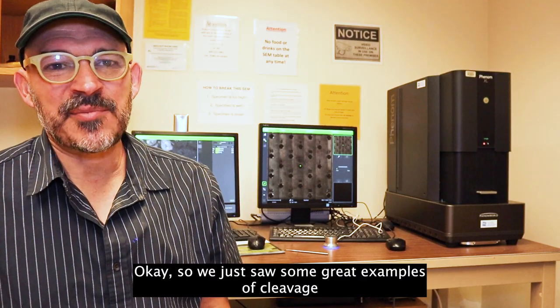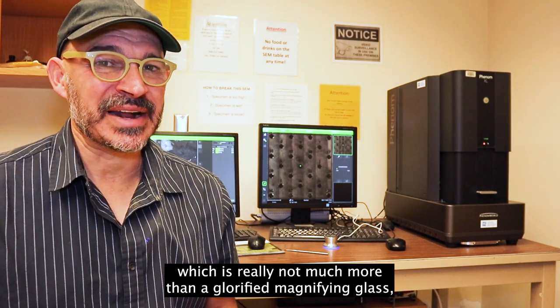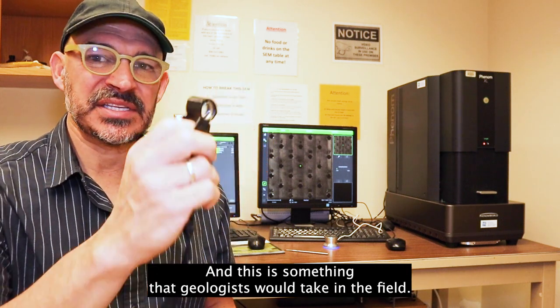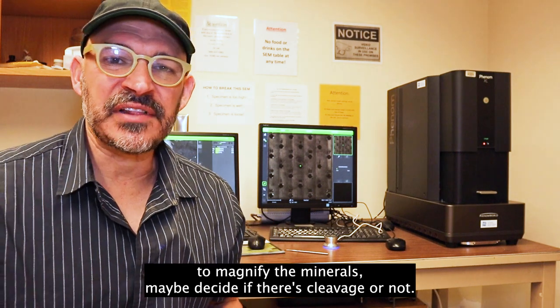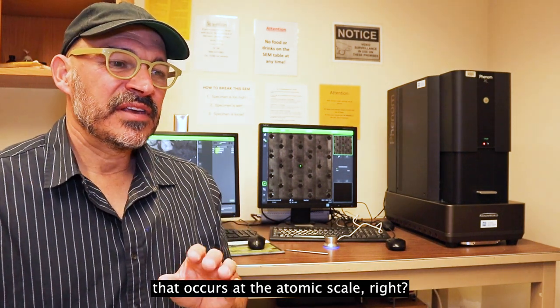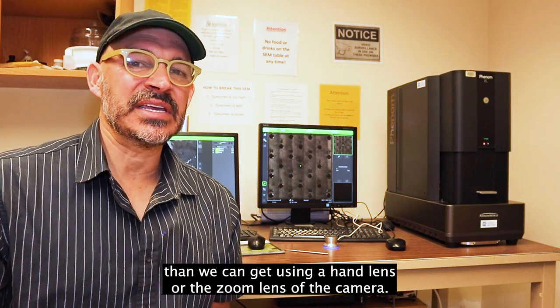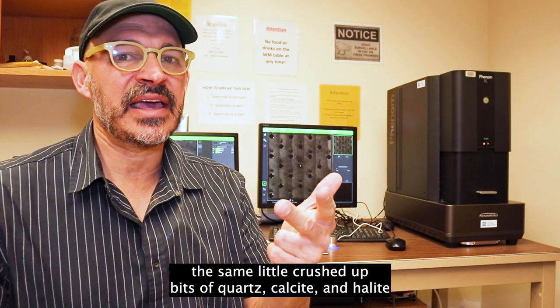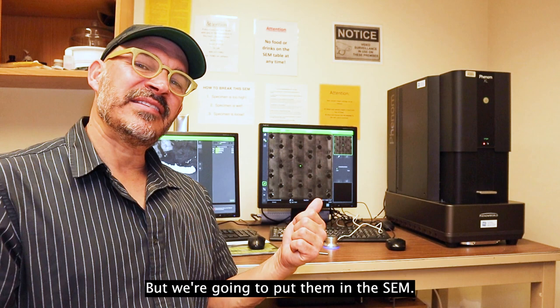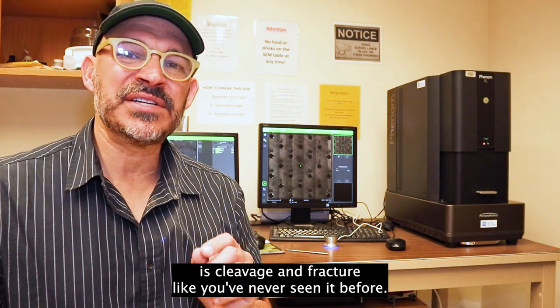We just saw great examples of cleavage in minerals at high magnification using the zoom lens of a camera, which is really not much more than a glorified magnifying glass — kind of like a hand lens that geologists take into the field to examine rock specimens and decide if there's cleavage or not. But cleavage occurs at the atomic scale — between atoms — so it occurs at much higher magnifications than a hand lens or camera zoom can achieve. That's why we're here with this bad boy: a scanning electron microscope, or SEM. We're going to take the same crushed bits of quartz, calcite, and halite and go to really, really high magnification — length scales shorter than the width of a human hair — and you're going to see cleavage and fracture like you've never seen it before.